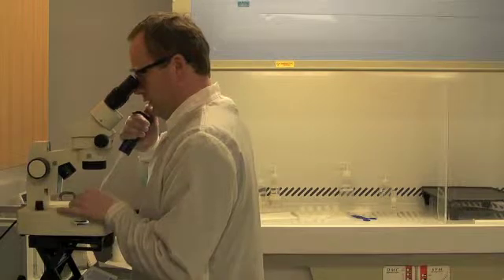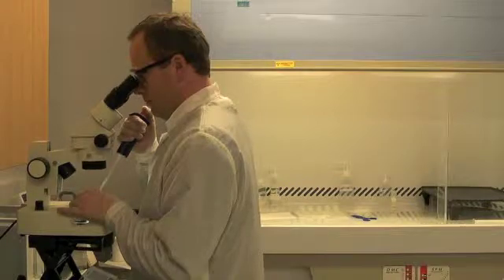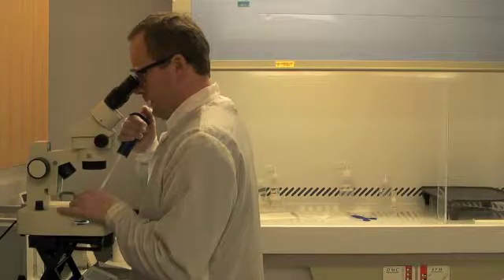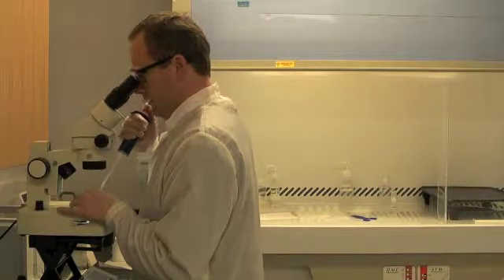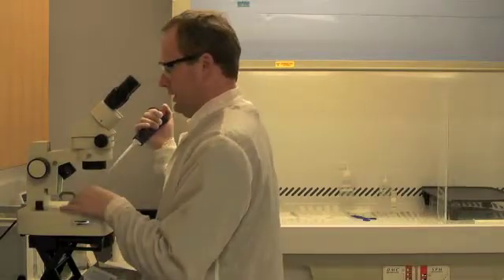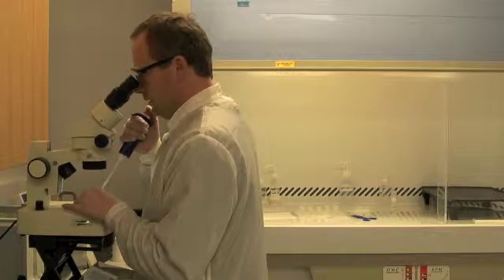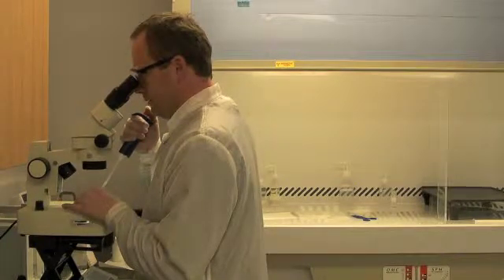I have to find the zircon, pipette it out of the beaker into the pipette, discard the liquid into a waste beaker, and place the crystal in that little bit of water back in the beaker.